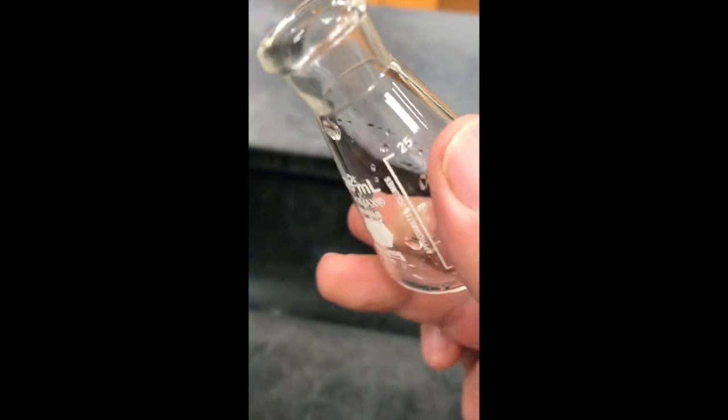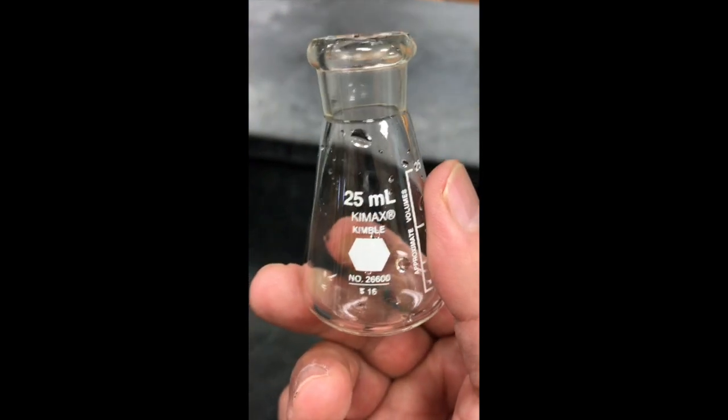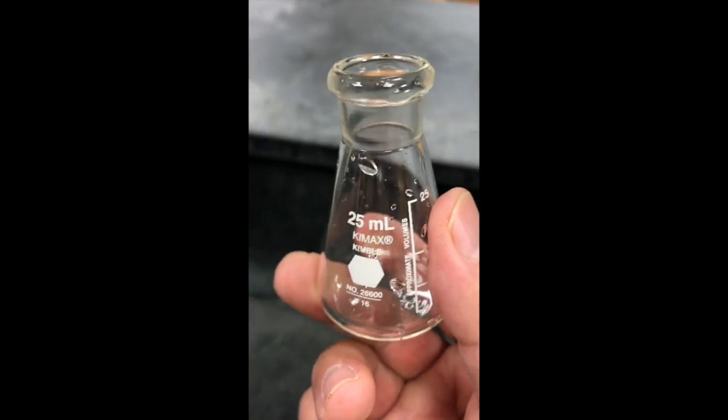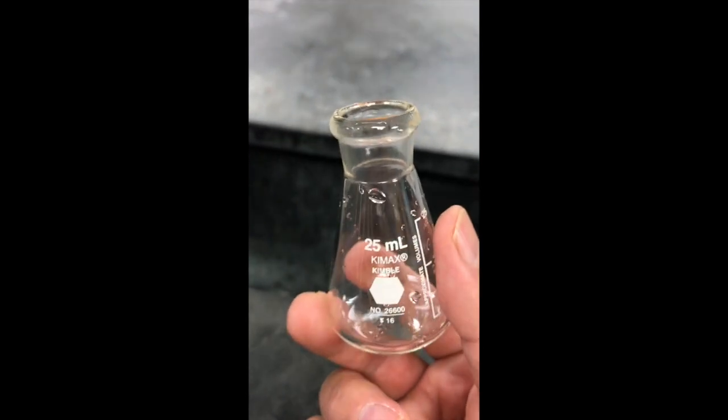So now I need to empty out the flask with water, and I need to pour the unknown liquid in here. But the problem is that there will be water droplets left inside the flask. Even if I do a good job of shaking out the water, there will still be droplets of water in here. And the droplets of water are going to contaminate the pure liquid, the unknown liquid that I put in here. So I've got to get this bone dry. I've got to get all these water droplets out. And I don't have the time to just wait for it to evaporate.